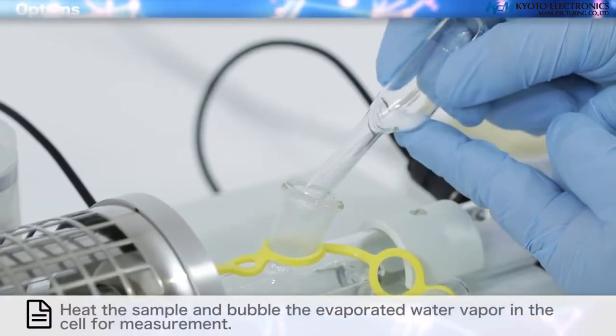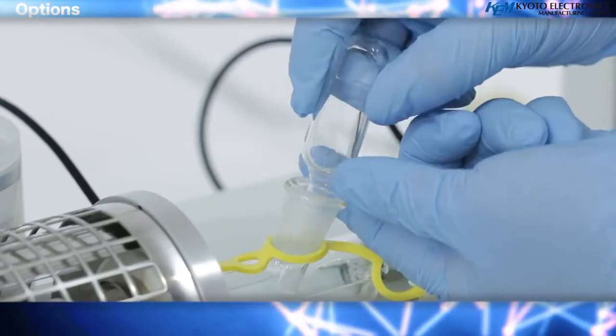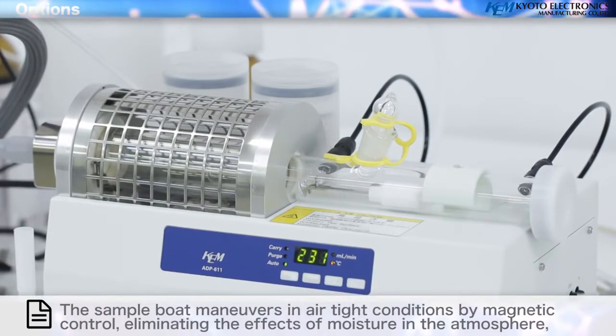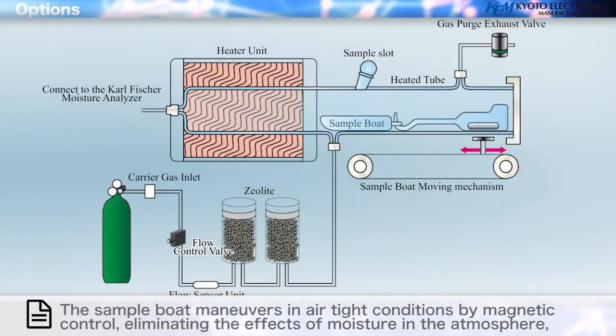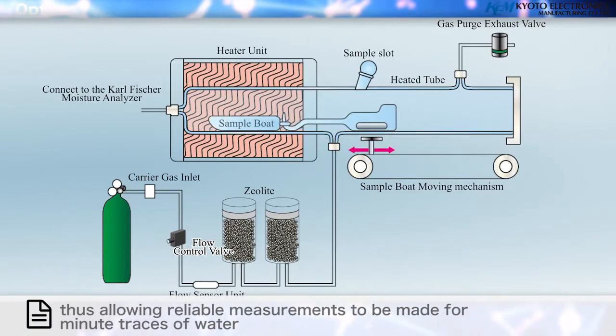Heat the sample and bubble the evaporated water vapor in the cell for measurement. The sample boat maneuvers in airtight conditions by magnetic control, eliminating the effects of moisture in the atmosphere, thus allowing reliable measurements to be made for minute traces of water.